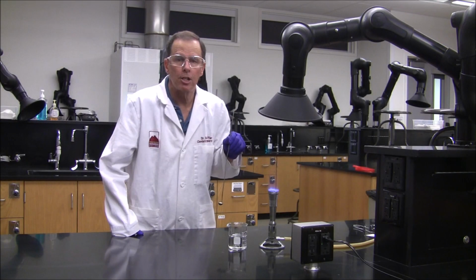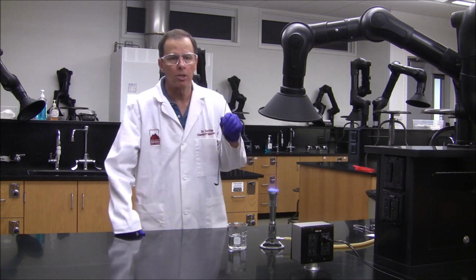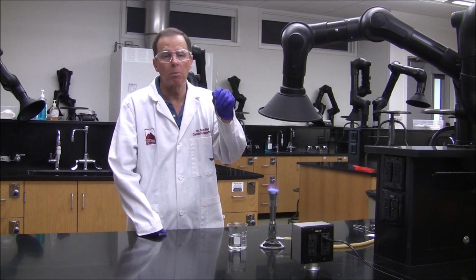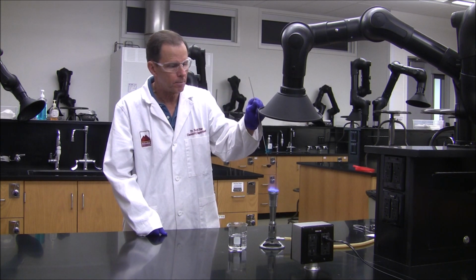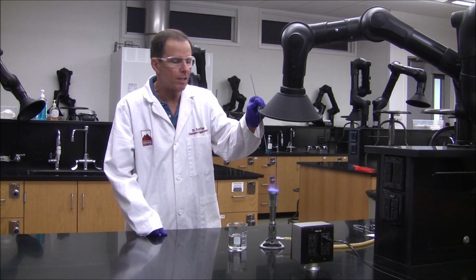The third reaction is also a composition reaction, but this time between 2 nonmetals. I've filled a deflagrating spoon with sulfur, and I'm going to place the sulfur into the Bunsen burner flame to provide the energy required to cause the sulfur to react with elemental oxygen in the air. The sulfur, which has a low melting point, will first start to melt, but then evidence of the chemical reaction will be seen shortly after that.